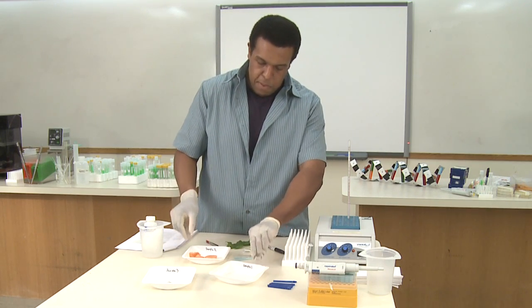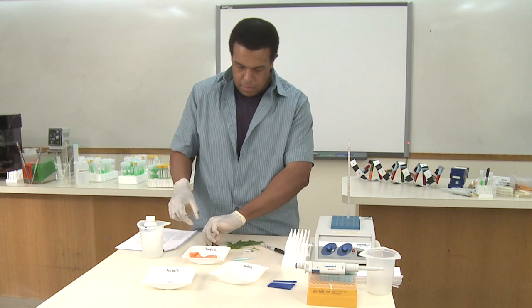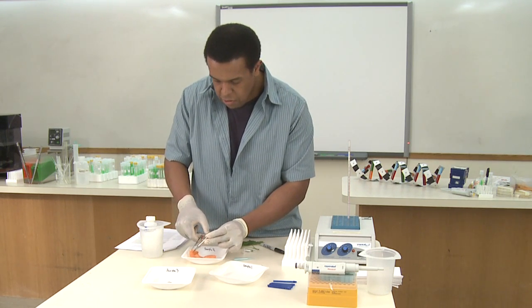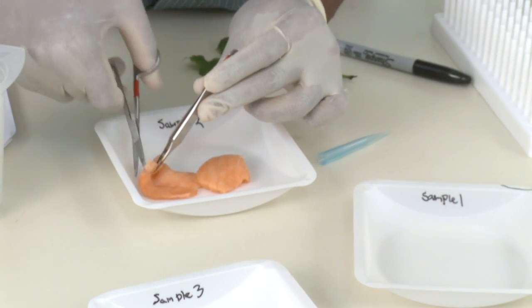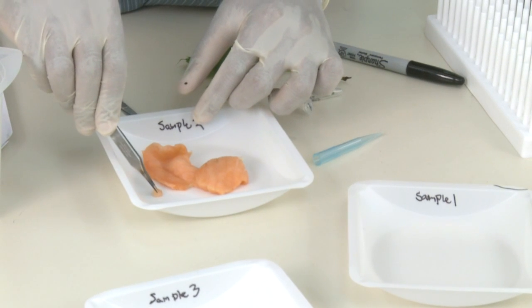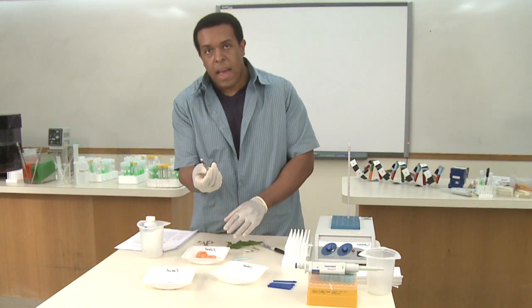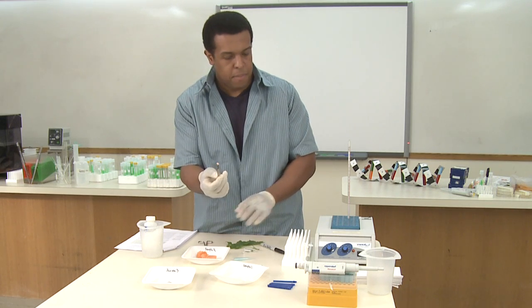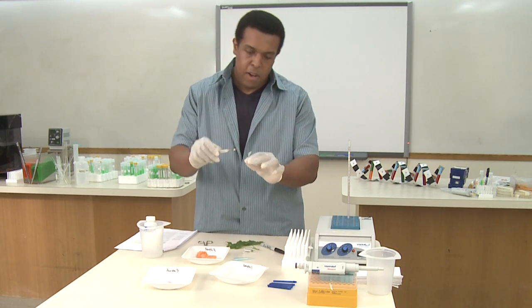To illustrate with this piece of salmon, I'm going to take the scissors and forceps and cut off a very, very small amount — a little bit less than the size of a pencil eraser. That's just the amount you need in order to get quite a bit of DNA. I'll take this and put it in my tube.